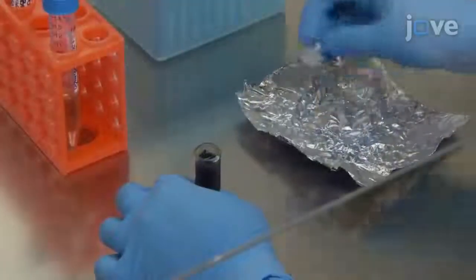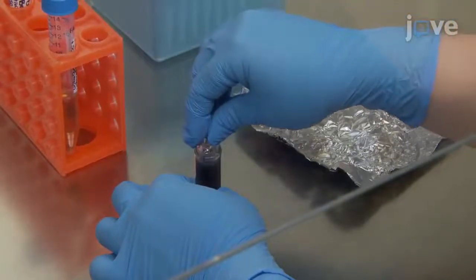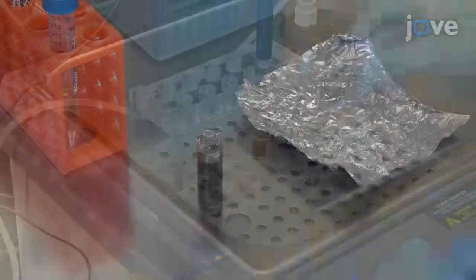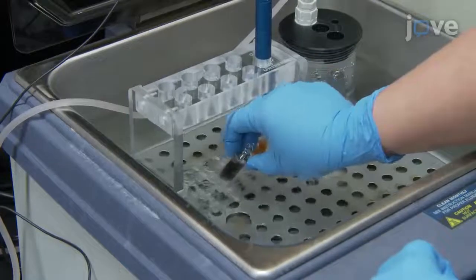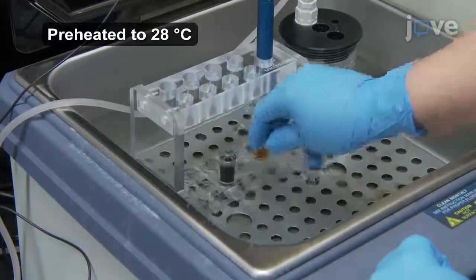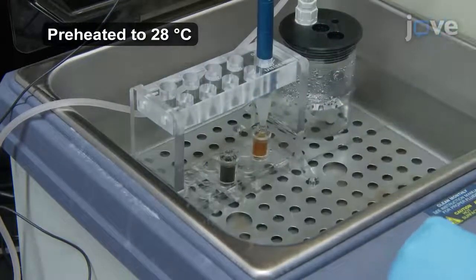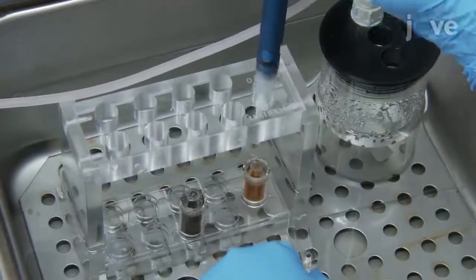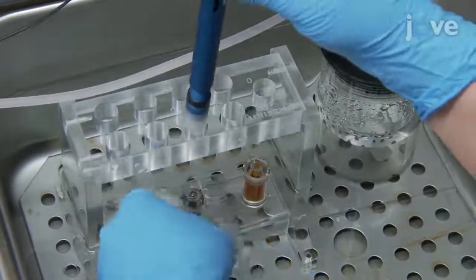Place the chamber lid in the chamber to create an airtight seal. To obtain the OCR measurement, first place the chamber in the chamber rack inside a water bath. Then place the oxygen probe inside the opening of the chamber.